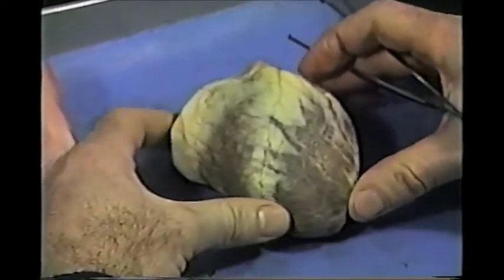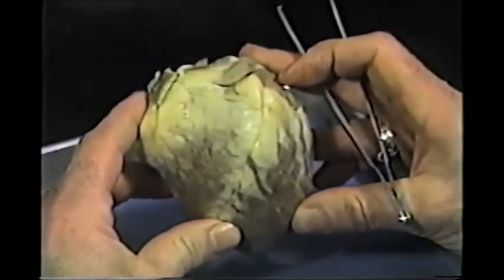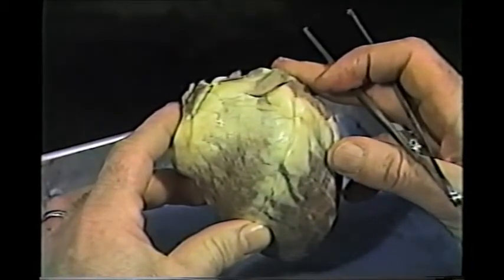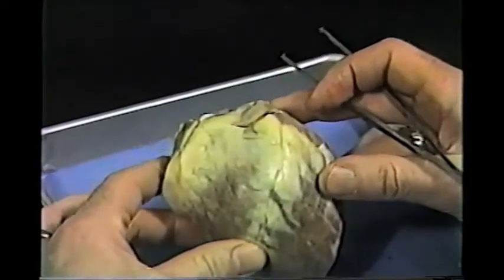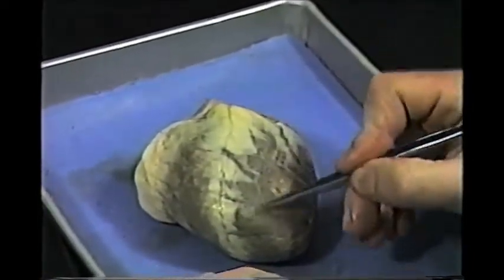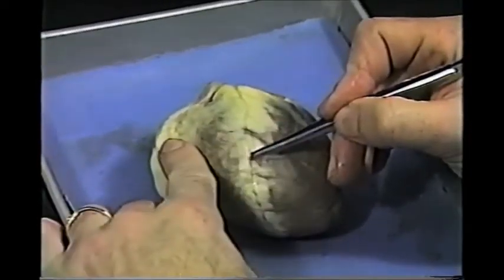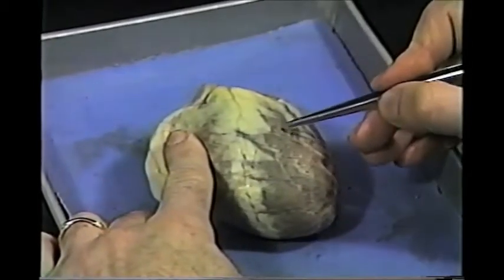This would be looking at the anterior surface of the heart if the heart were in the sheep or a person and you were looking at them face on. When you talk about right or left, you talk about the heart's right or left as it sits inside the person's chest or the sheep's chest. So if this is the anterior surface, then this is the left ventricle — the part that has the apex. From this septum this way, this is the right ventricle. So this is the sheep's right ventricle, the sheep's left ventricle.